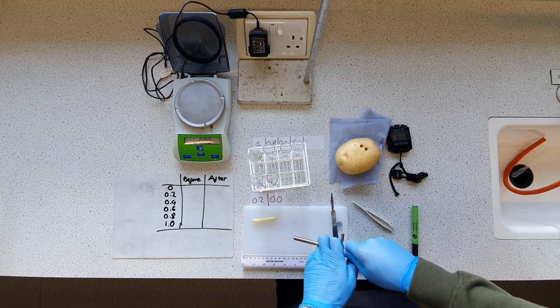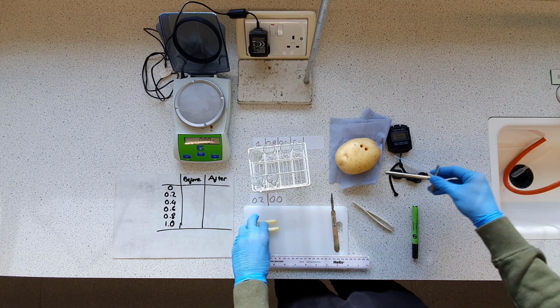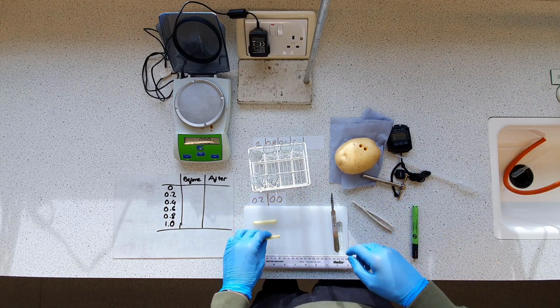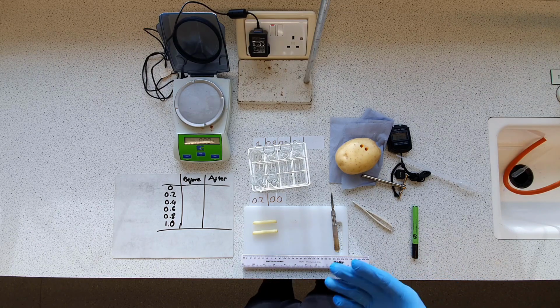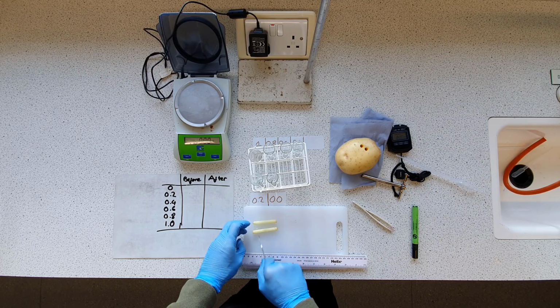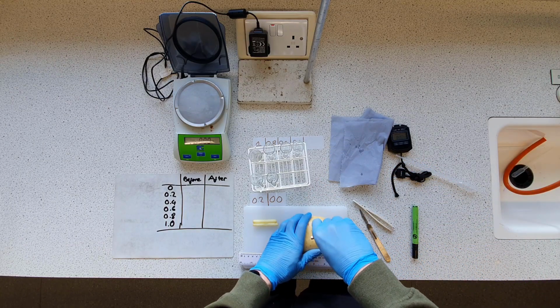Where's my pipette? Very proper use of a pipette. There we go, just to get the little end out. What's also important, some of you might be thinking this, is but wait, if we've got our core here, at one end or at both ends, you've got a bit of potato skin, this stuff. And that's definitely not going to have the same sort of semi-permeable status as the inner flesh here. So what I'm going to do is, as close as I can, remove each end of all the cores I make so that we just have a repeatable, fair sort of standard of core.